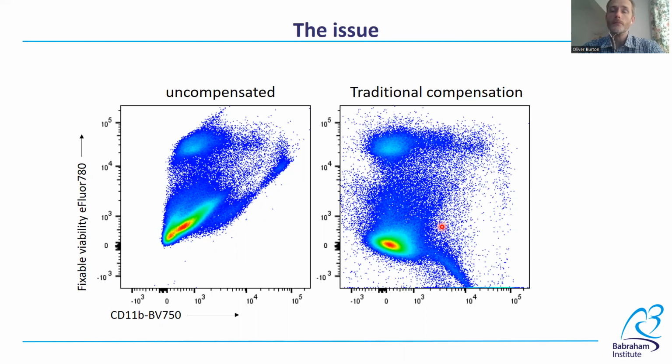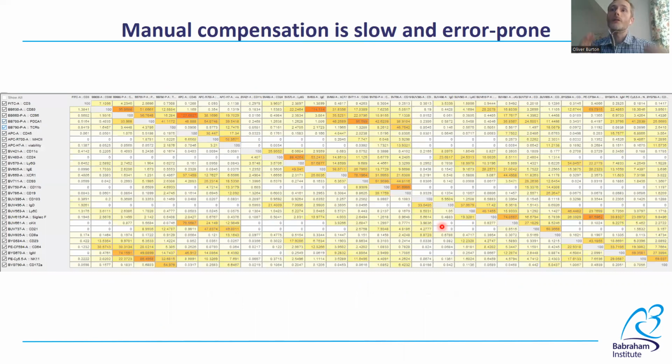Clearly not great. My immediate solution to this was to go back to the way I had done compensation when I first started, manually adjusting all the coefficients until the controls were correctly compensated. As you might imagine, this takes a while for a 28 by 28 matrix. Moreover, any small errors propagate through the parameters. So I would have to go back and refine the matrix multiple times. To do this, I was using cells stained with the actual markers in our panel, relying on the slope of the data, since most of the markers don't actually bifurcate neatly into positive and negative populations.